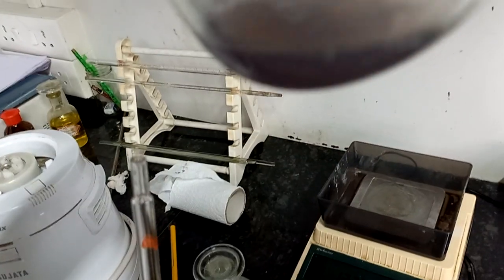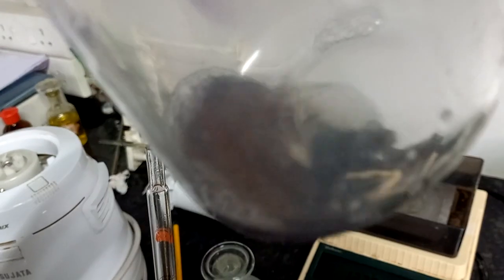Now color change to blue-black color. Now titration ends and measure the reading.